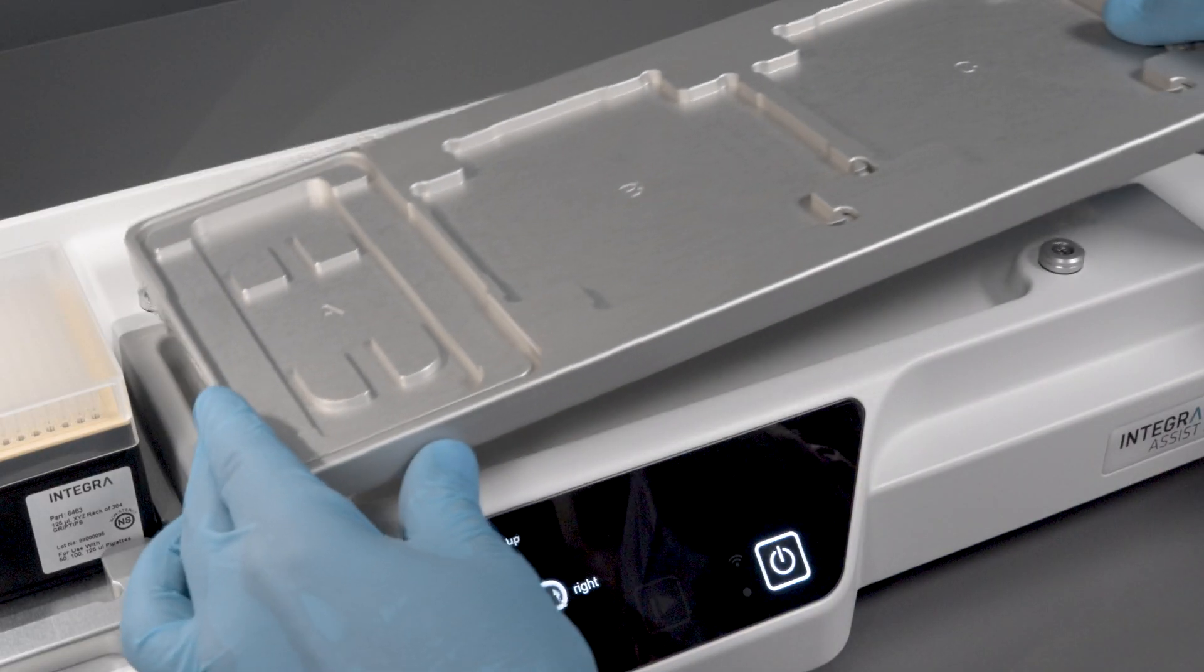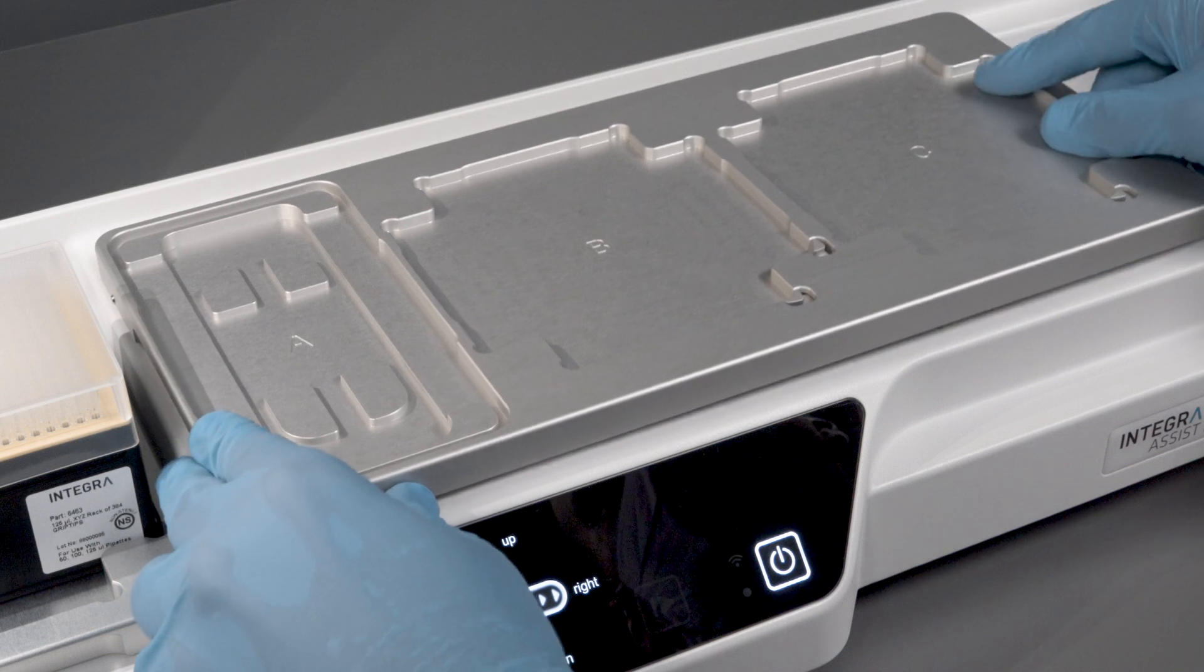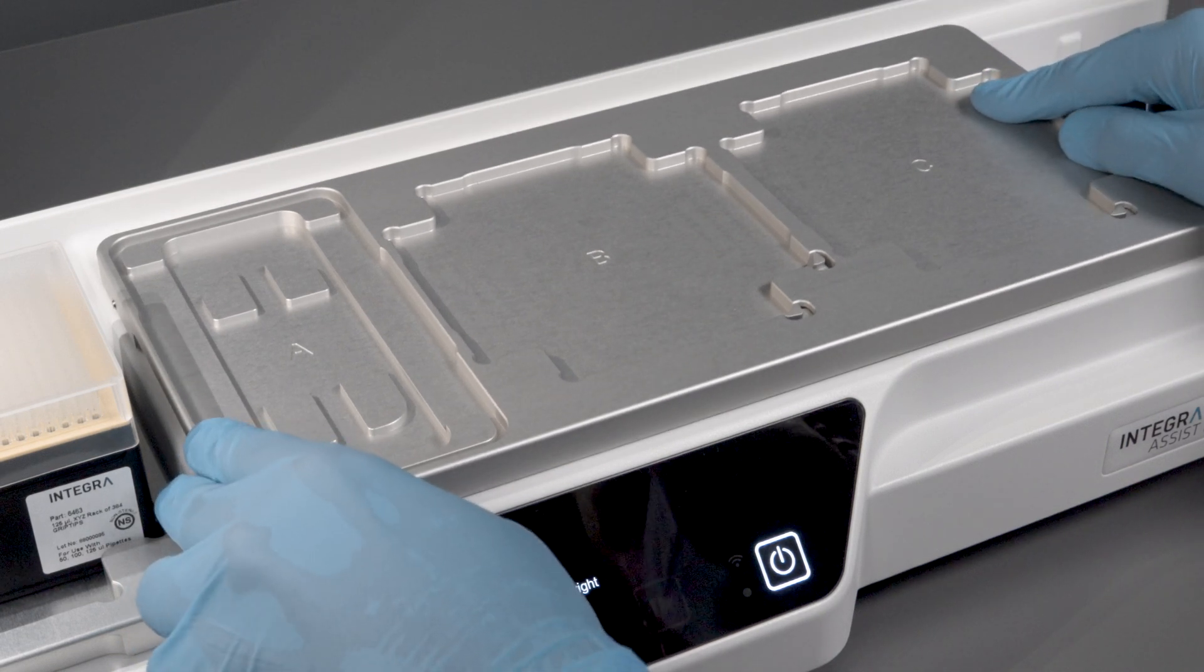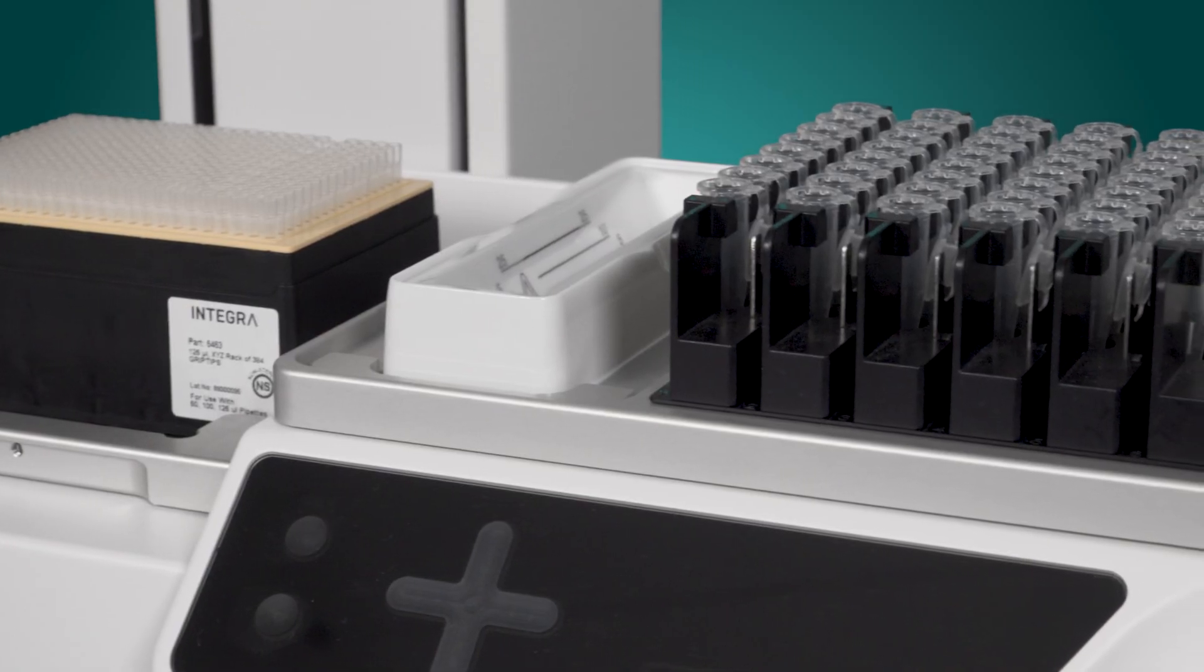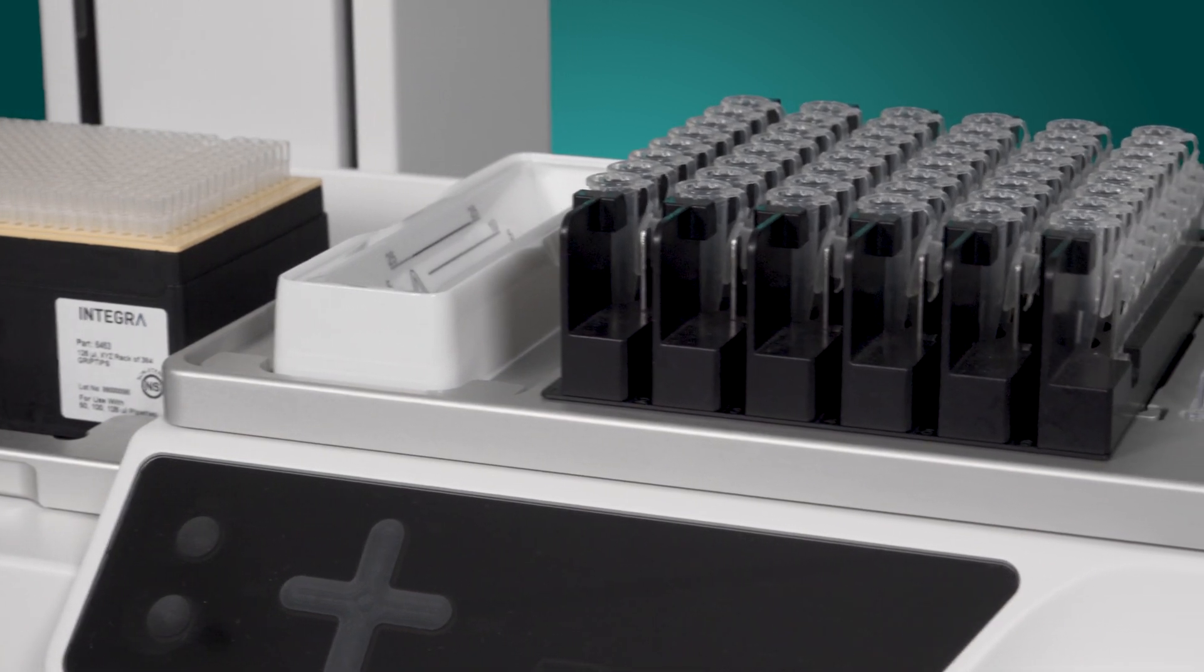Next, mount the three-position universal deck in the middle of the Assist Plus. Again, press firmly. Here, the labware items are placed.